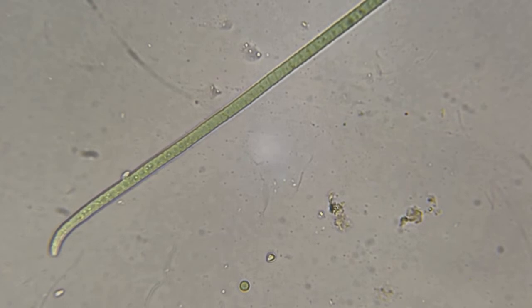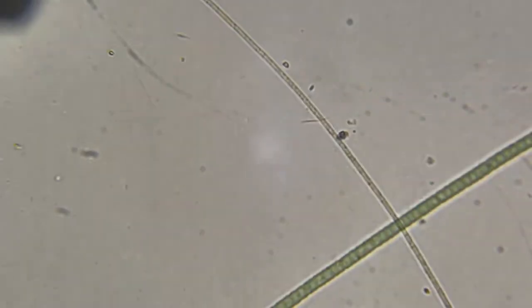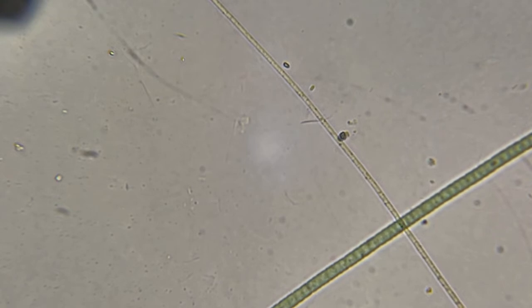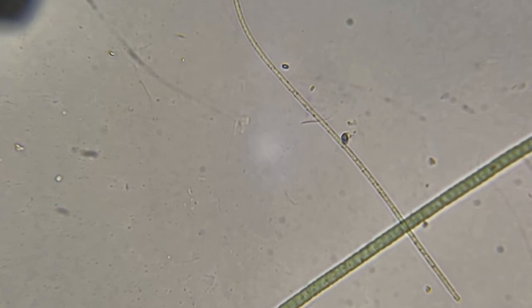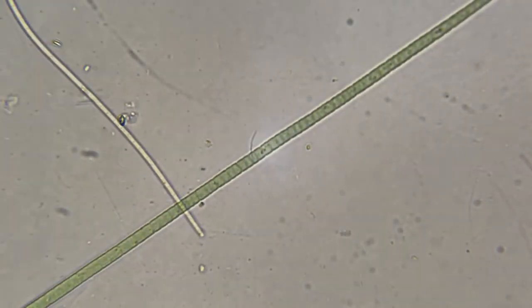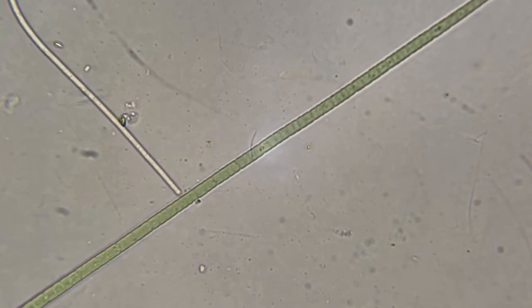And that little thing crawling along it is not bacteria, because bacteria don't look like that. And see the cyanobacteria right here, how they move? I mean, they actually move on their own. And they produce oxygen. Now cyanobacteria can be bad also, if you get a lot.